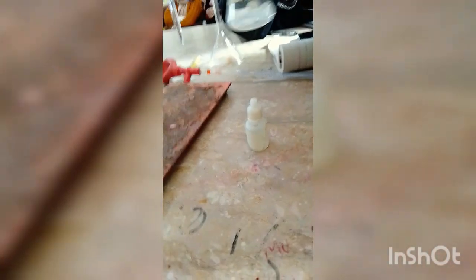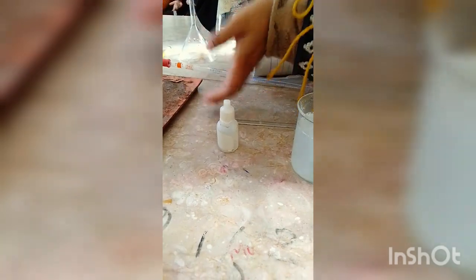There is a burette stand and the burette is hanging here. In the burette we have sodium hydroxide solution, 0.1 molar. Add the sodium hydroxide solution and note the change in color. Add the solution dropwise because sometimes a sudden color change can happen.